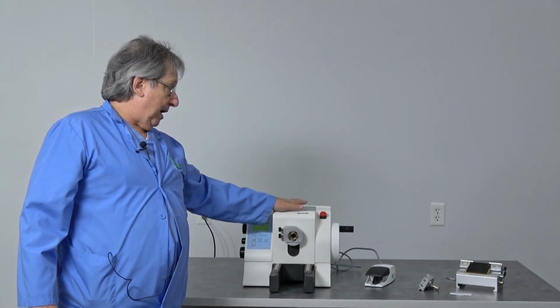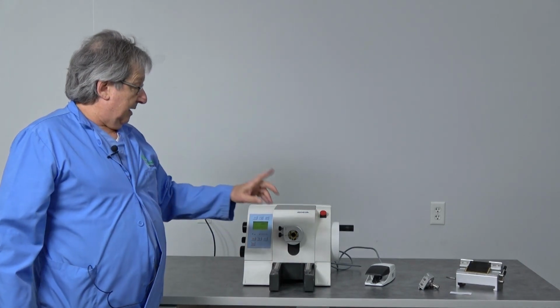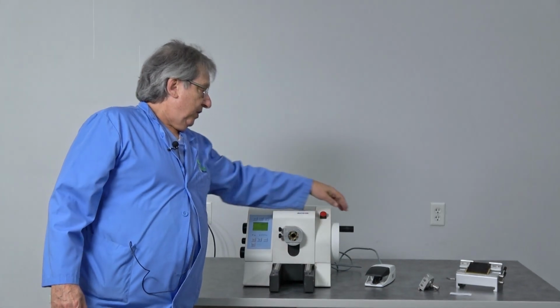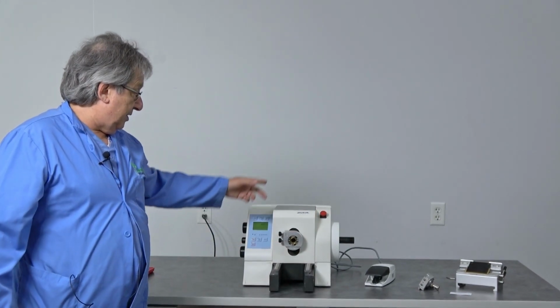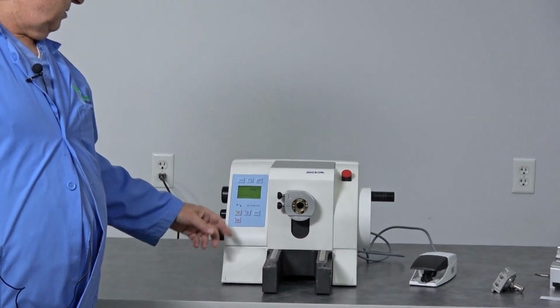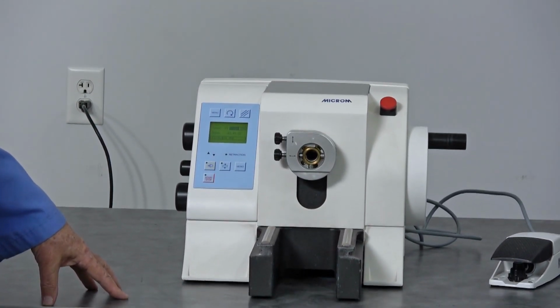Now another problem that these seem to have, and this one is no exception, is the control that moves the cutting motor up and down. Other dealers may have figured out the ways to fix these. They're something we're not interested in doing.